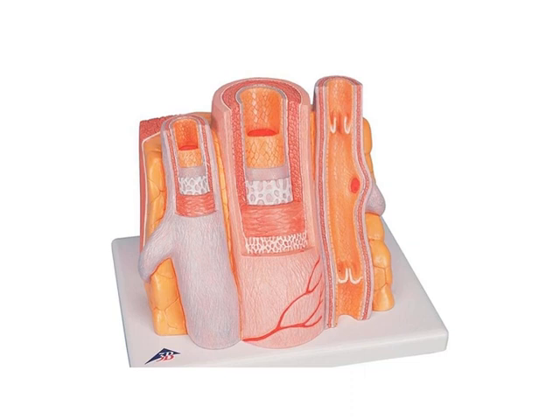This recording is going to look at the histology of blood vessels. I'm going to look at two models of the histology of arteries versus veins. Plus, we'll also look at some microscope slides. So we're going to start with this first model, which in the center is depicting an artery, and on either side, these represent veins. So I'm just going to start with the artery, and then we'll look at the veins.